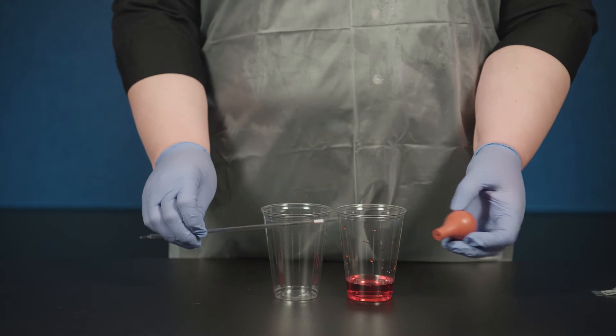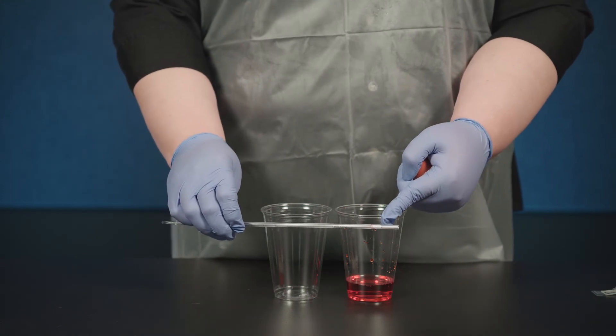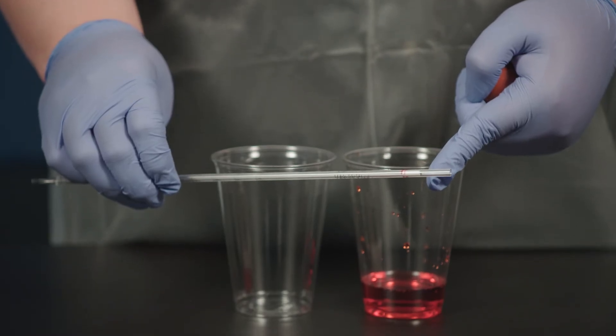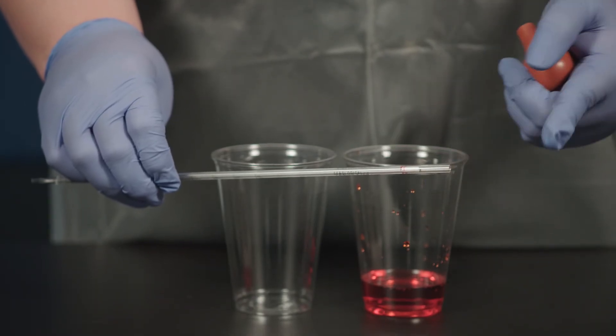To create suction and pull liquid into the pipette, you need a bulb or some other type of pumping device. You should never ever use your mouth to suck liquid into a pipette or blow liquid out.